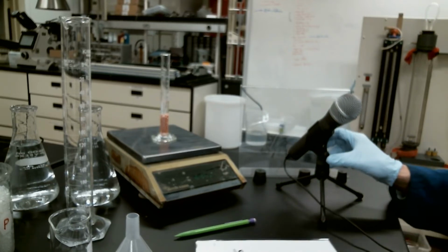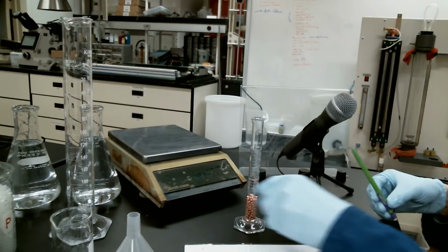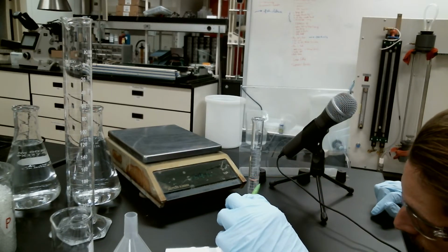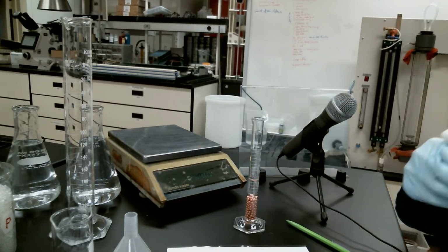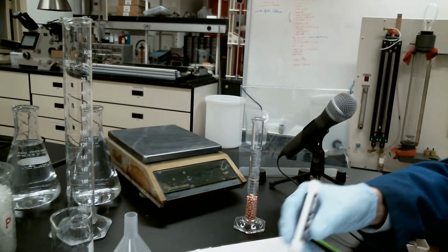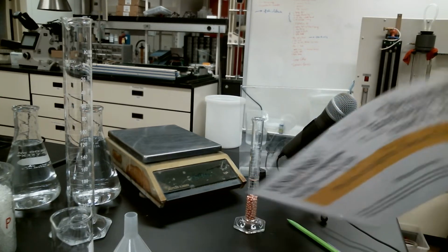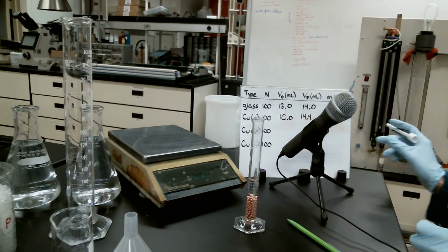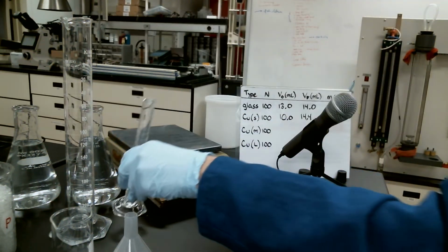And the volume that we're measuring on there, let me grab my pencil over here. Let's take a look here. About 14.4 milliliters. So each one of these volumes are being read to the closest 0.2 milliliters. So I'll go ahead and add that as each one of my measurements here. We can go ahead and get rid of our copper spheres. We're not going to need those fellows anymore. There we go. Actually, we won't need that smaller one.